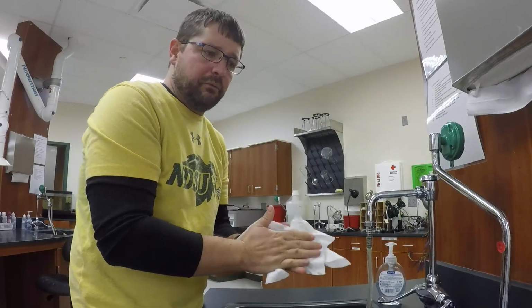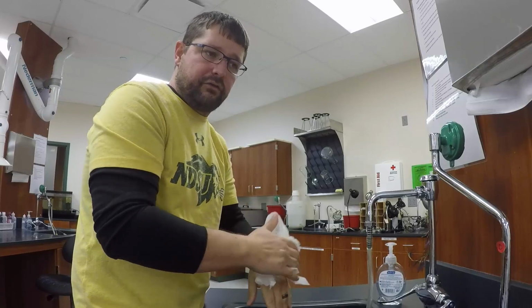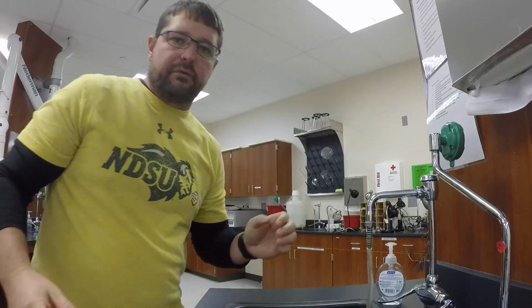Okay. And then on the other side of the dish, I'm going to wipe the same 2 fingers down the other side of the dish. Now, like I said before, you guys are going to do this with 2 dishes.